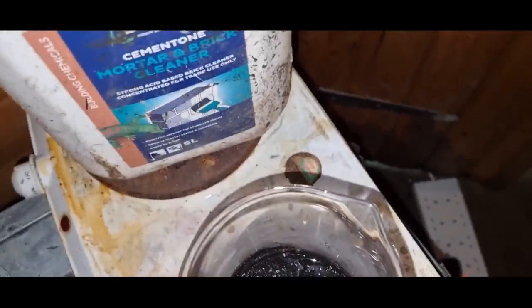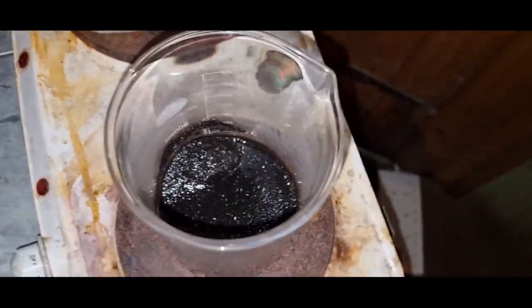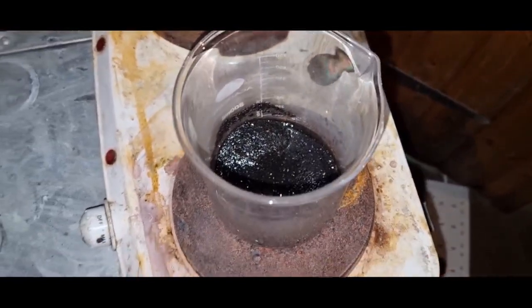Put it on the hot plate. Put in some hydrochloric and then I'm going to add some sodium nitrate and put it on heat and I come back when it's bubbling away. Almost done.